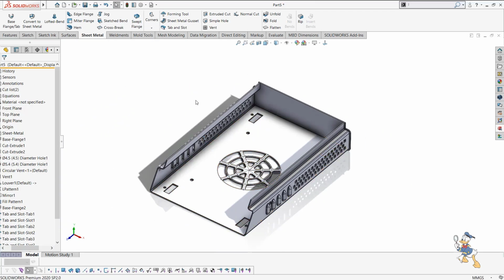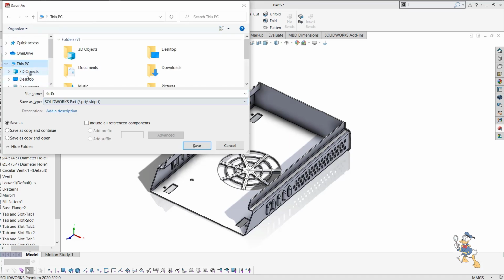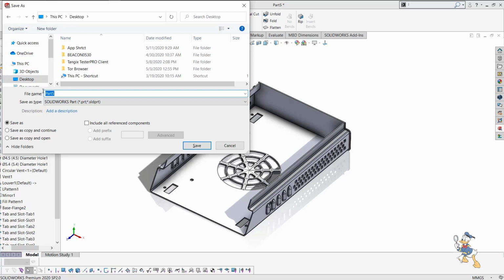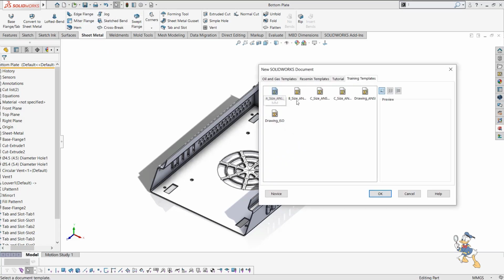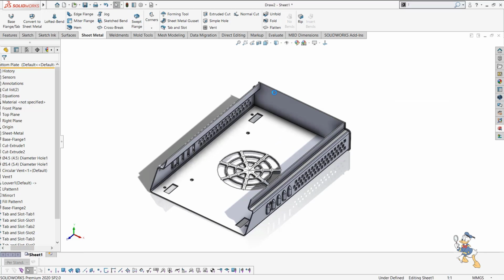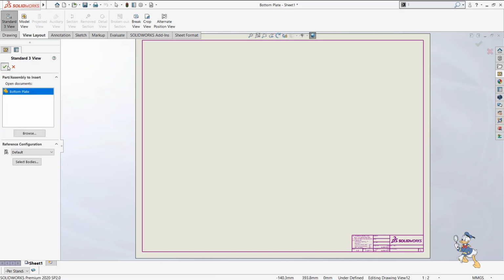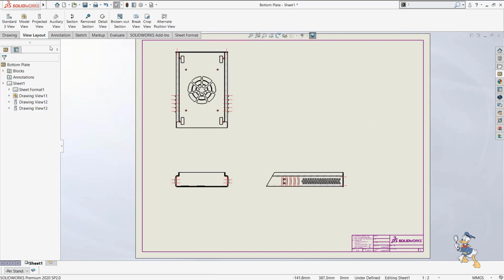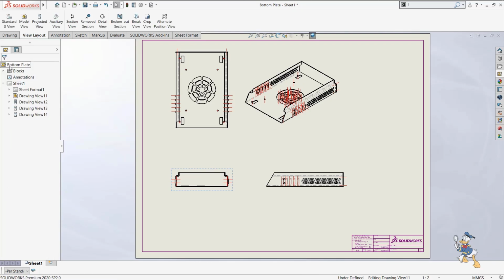And suppose we need to manufacture it, so we need to have a drawing of it. So let me save it on the desktop or somewhere else, wherever you want to save it, and then I just need to generate a drawing for this. It is very easy to generate a drawing for this kind of sheet metal component. I just need to select some sort of template, and then select the standard views of this part. It will automatically generate some standard views of this component, and then I can generate a projected view like this as well.